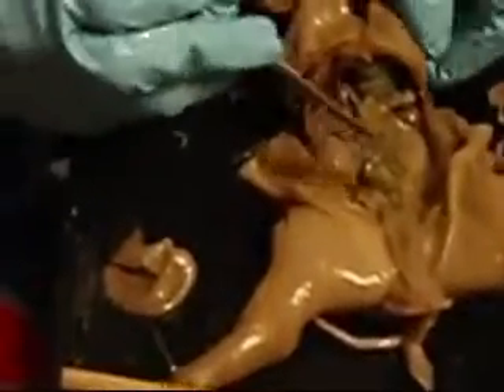Next, we're going to look at the male or female parts. If it's a male, you need to find the scrotal sacs at the posterior end of the pig. The testes are located in each sac, and you'll need to open the scrotal sac to locate them. Since this pig is female, we're going to locate two bean-shaped ovaries.